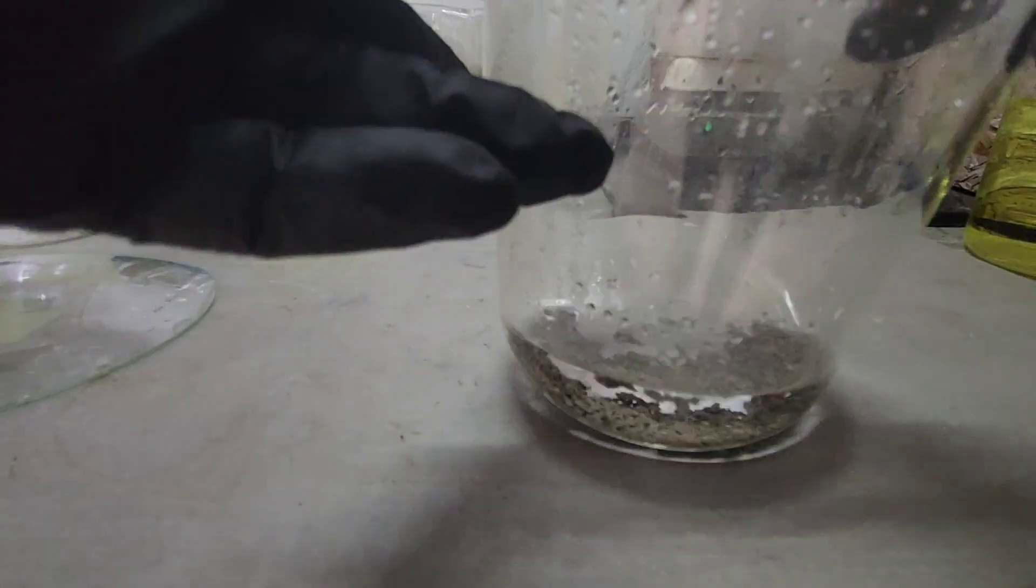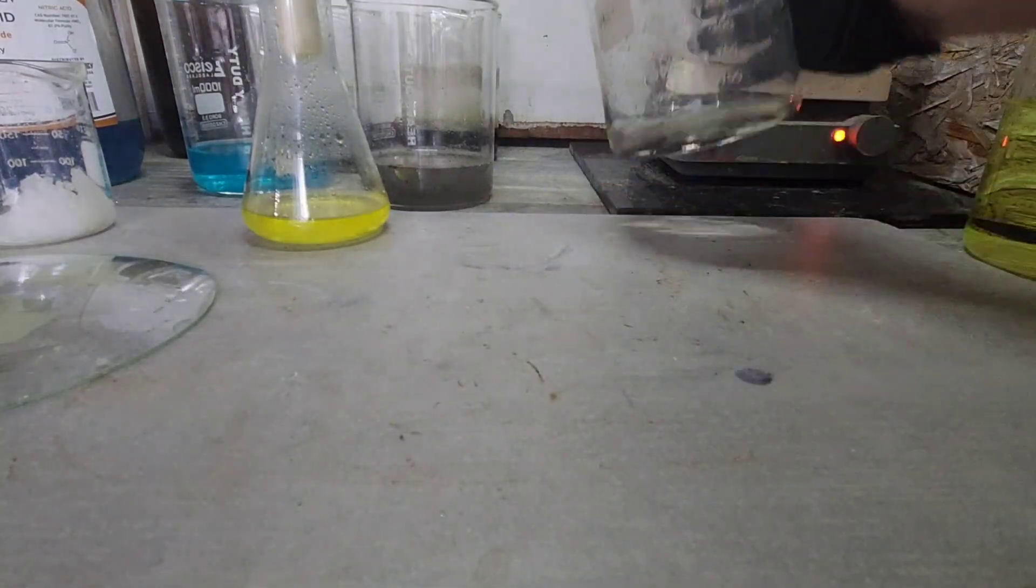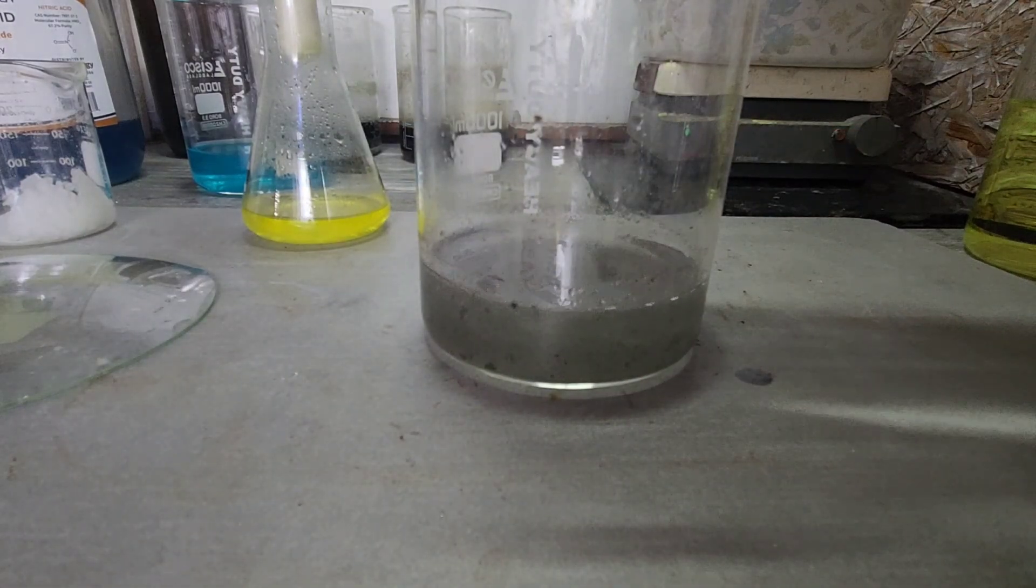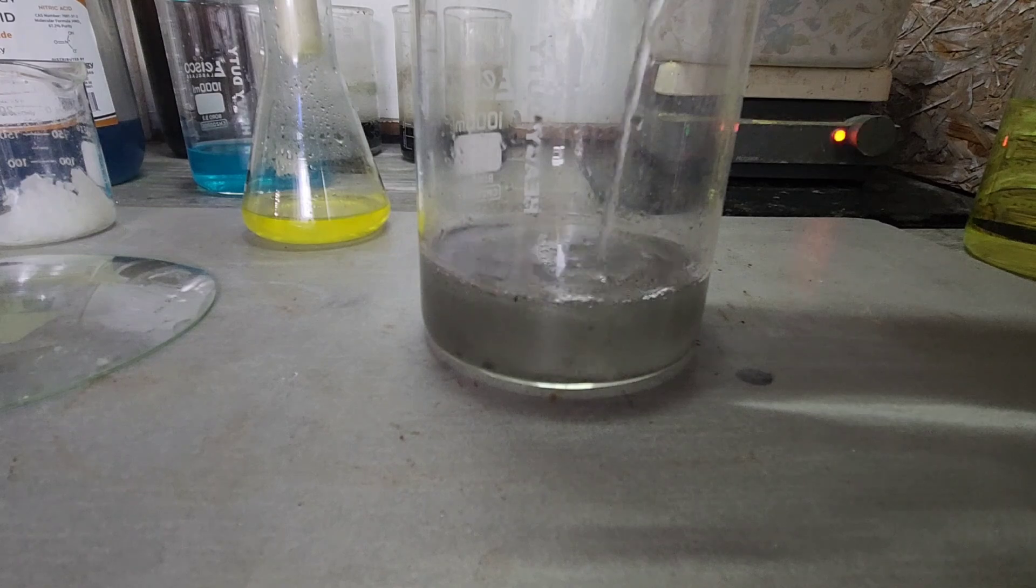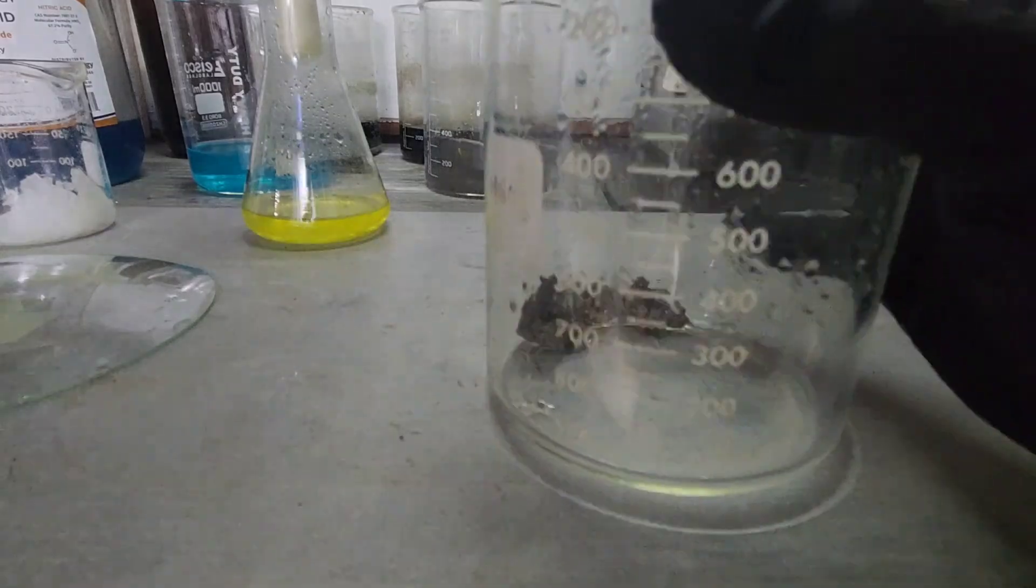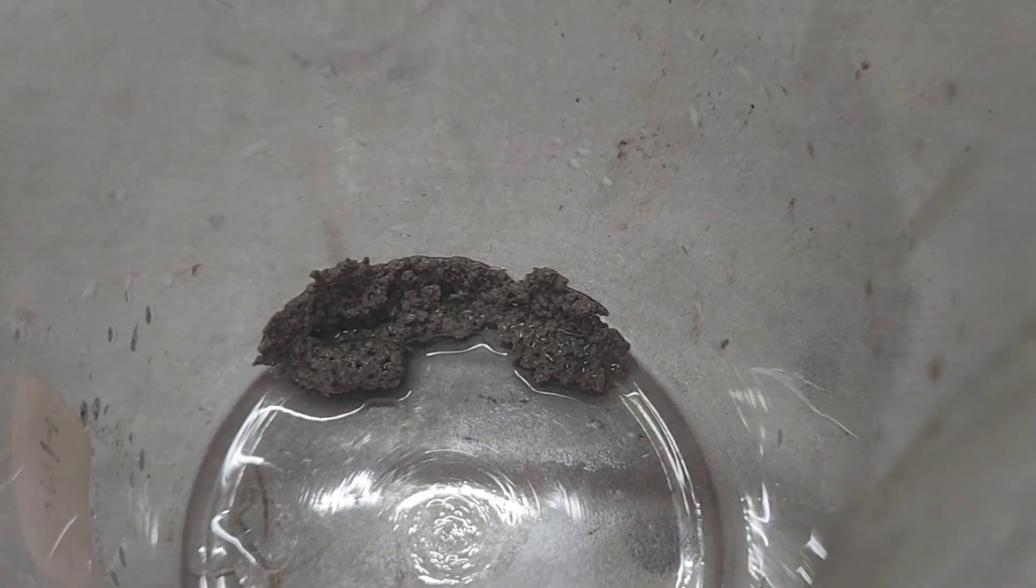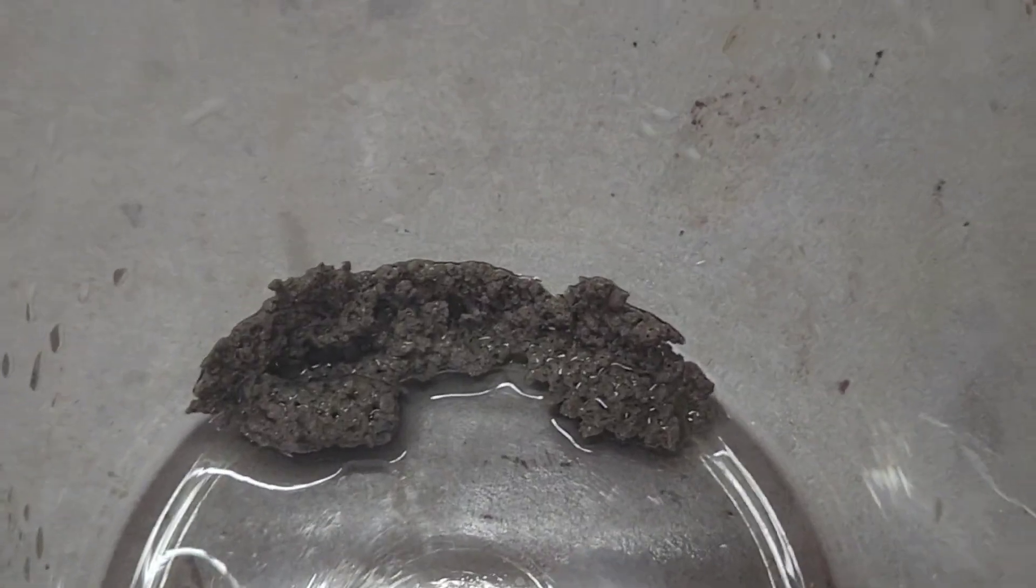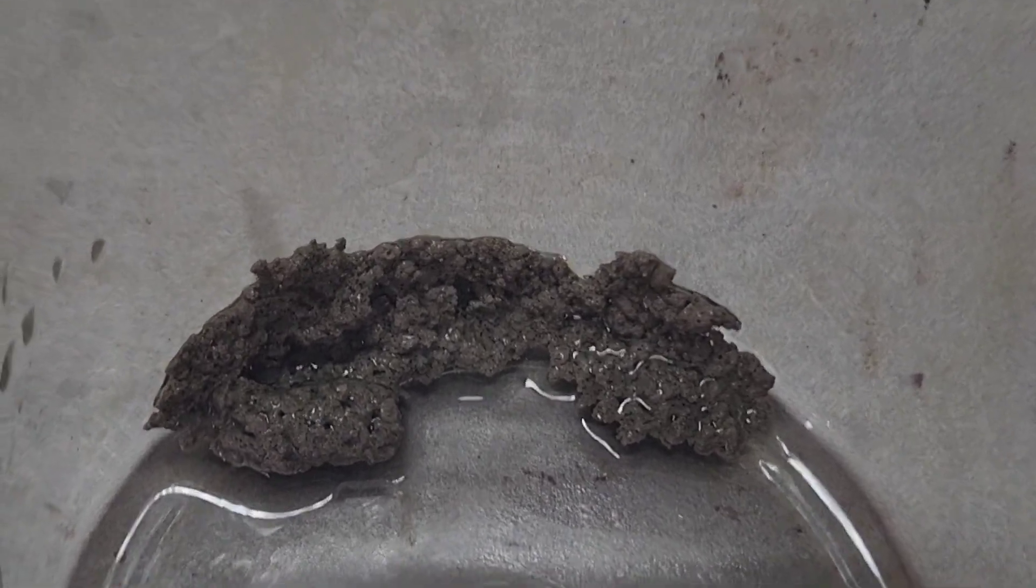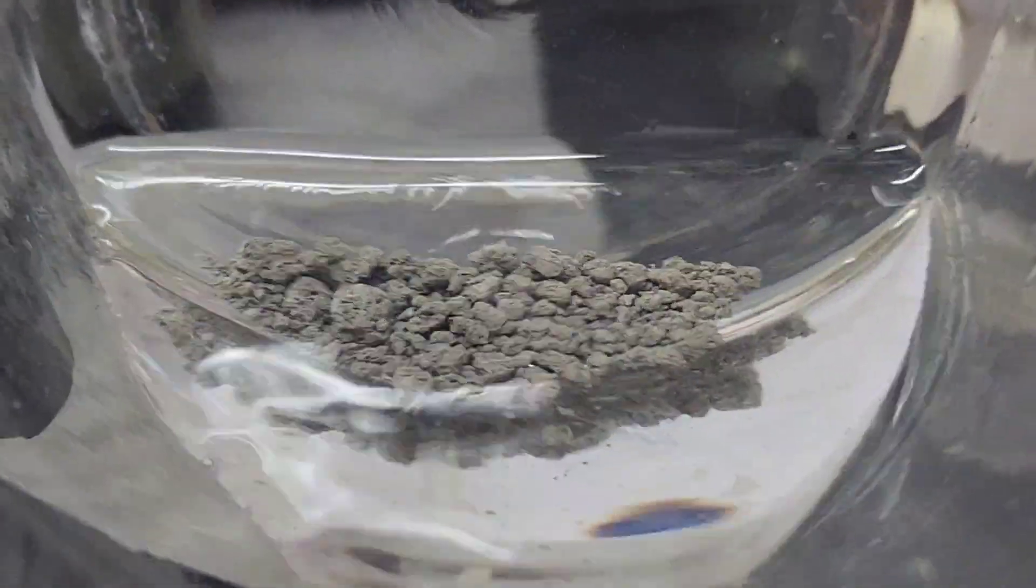We have some cement silver, it looks beautiful. Let's get rid of that hydrochloric solution, we don't need that anymore. You can see that we've got beautiful silver there. So let's do a couple more boils and then dehydrate it, give us a nice shot of that color. Beautiful color.